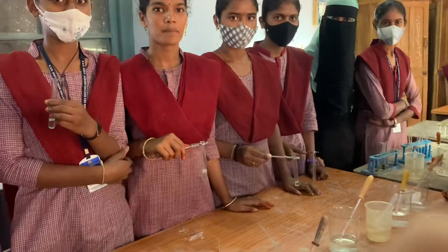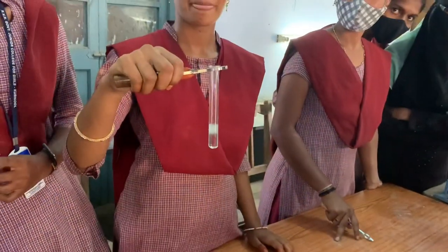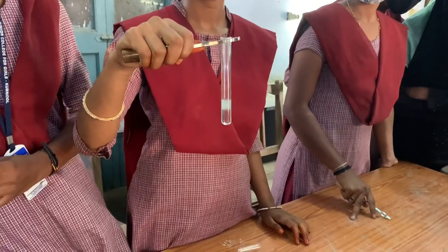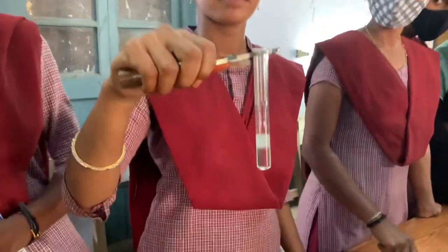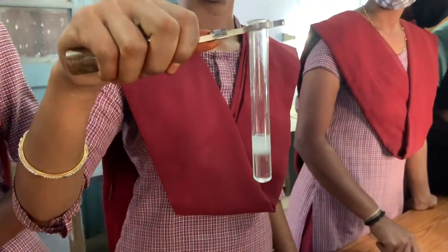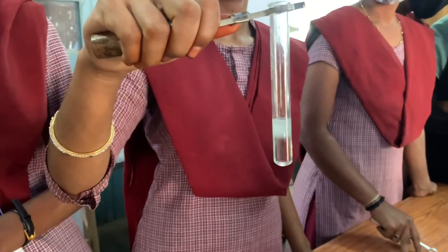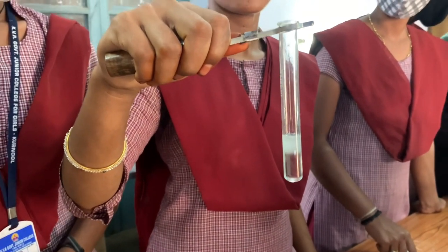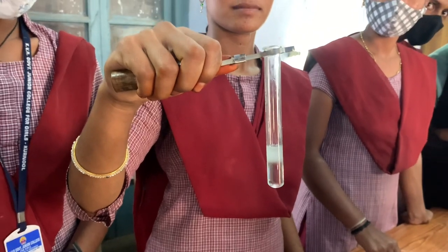Now you perform the experiment individually. If you don't add the sample through the walls, you get a band like this — this is not a ring, this is a band. So you have to add the sample very slowly through the walls. This is the precaution you have to take.